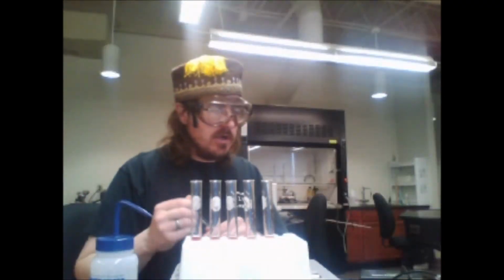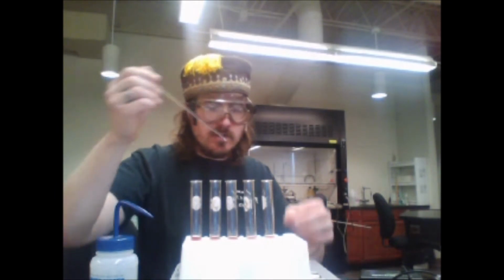The last part of this step is to just stir these guys to make sure they're well mixed.